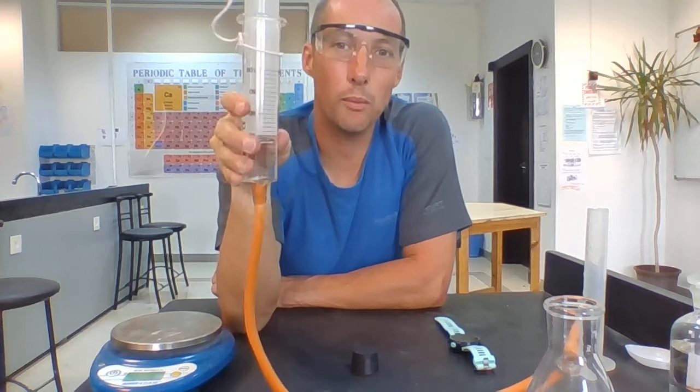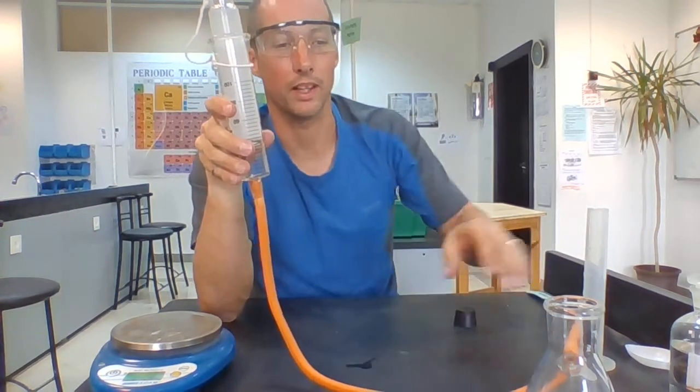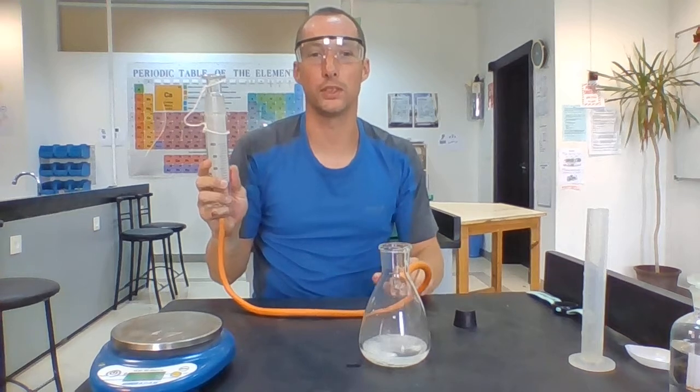So this is one way in which we can investigate the speed of a chemical reaction. Now this way, like the next way I'm going to show you in a minute, only works if you get a gas produced.